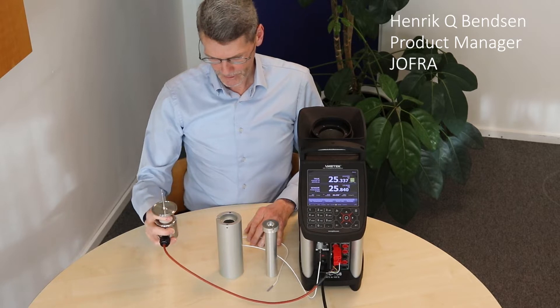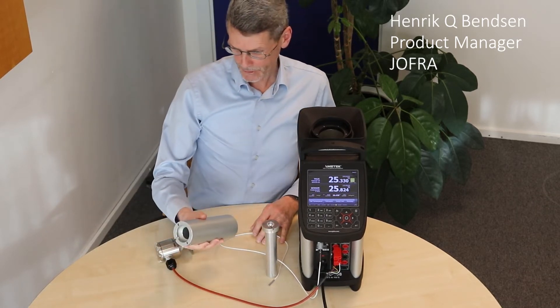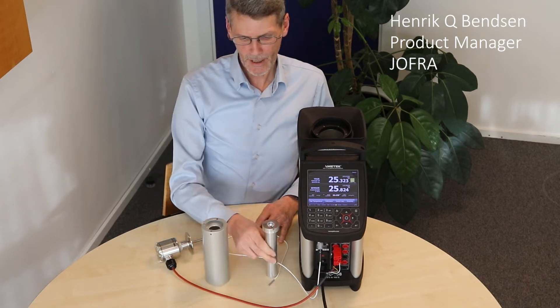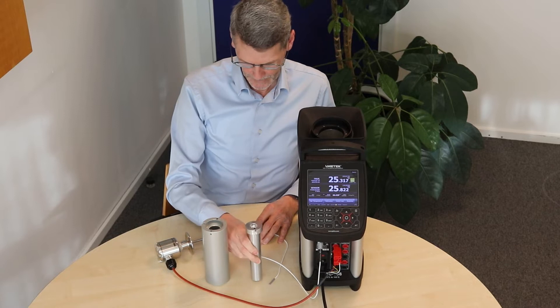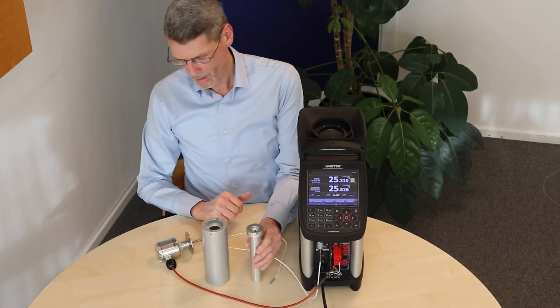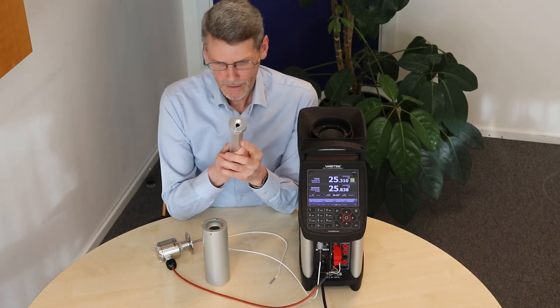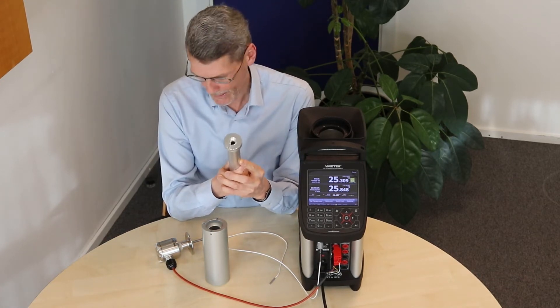Calibrating of a sanitary sensor dry in an adapter together with an RTC156 clamp insert. This is also a very simple setup. What you need is for users of RTC156 to reuse their clamp sensor.